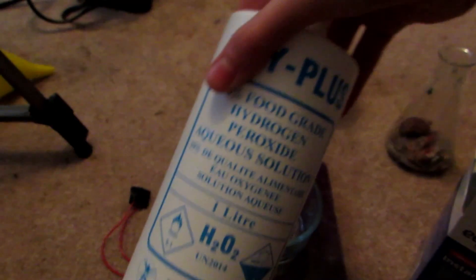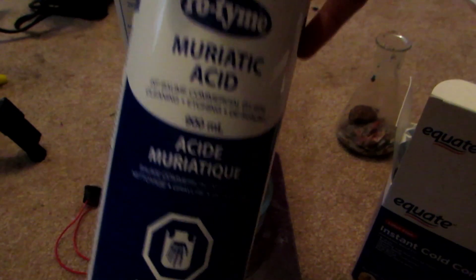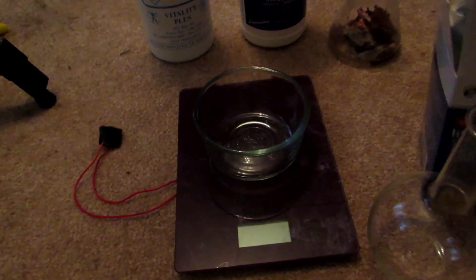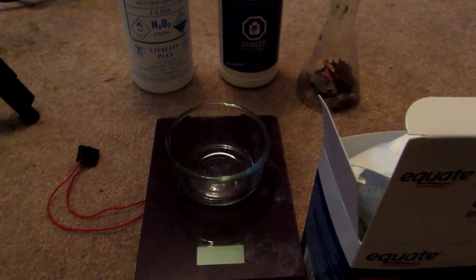We're only going to need a couple of things. We're going to need hydrogen peroxide — you could use water, but hydrogen peroxide just increases the yield. This is 30%, which I got from a pharmacy. We're also going to need some hydrochloric acid, which is sold as muriatic acid at places like Home Depot. We're going to need some copper, probably about 20 grams or so. This is all old copper that's really corroded, but it'll work just fine. You can use new copper if you want. And then we're also going to need a flask like this.